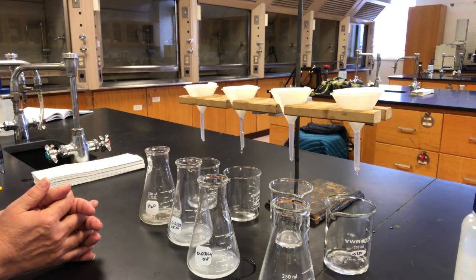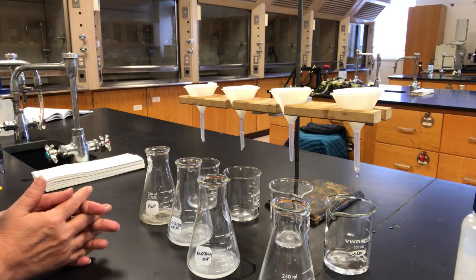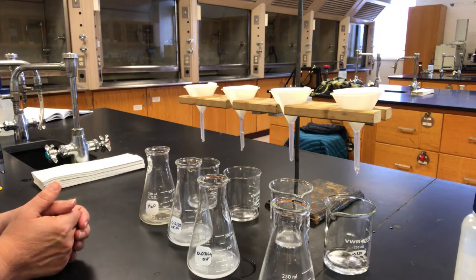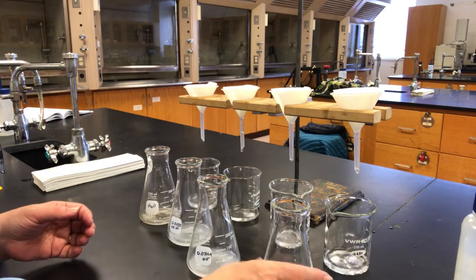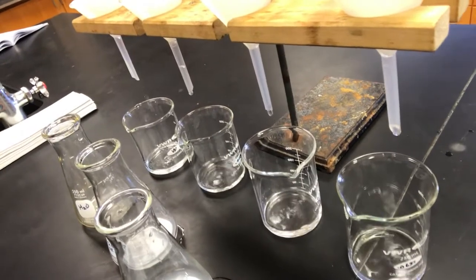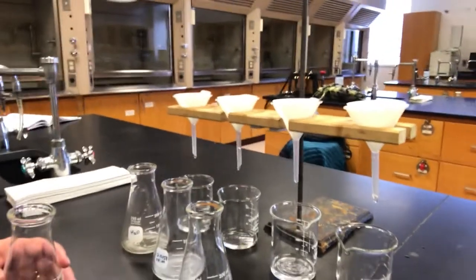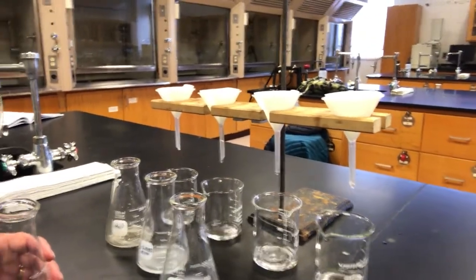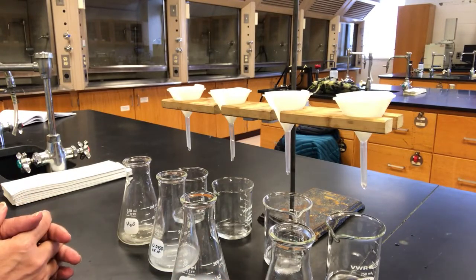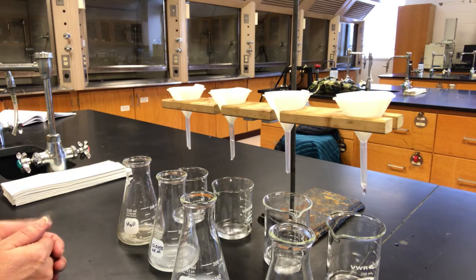So we'll just let those filter through, and I'll actually be filtering it a second time, but I'll do that off camera to make sure that any cloudiness is not in the solutions. Although it's doing a pretty good job this first time, you can notice that the solutions are pretty clear. There's not too much of the solid calcium hydroxide that I can tell that's sneaking through the filter paper. But just to be on the safe side, we will go ahead and filter it through a second time, and I'll do that off camera and also finish this filtering for you off camera because this is about as exciting as it gets.